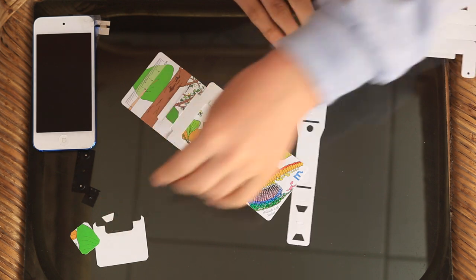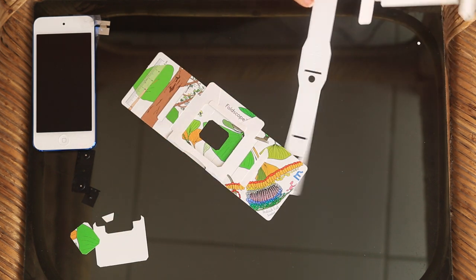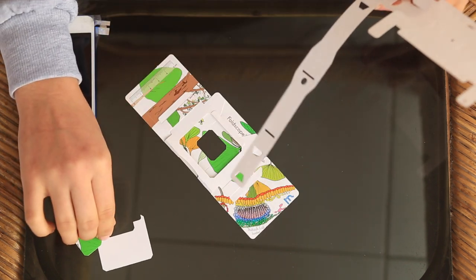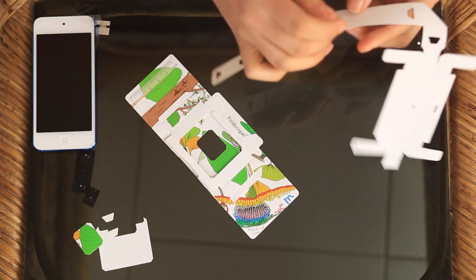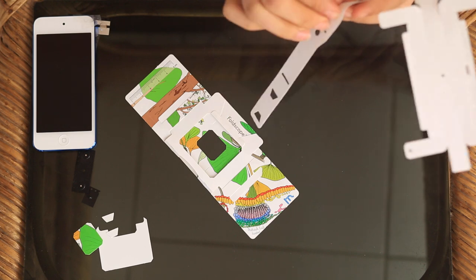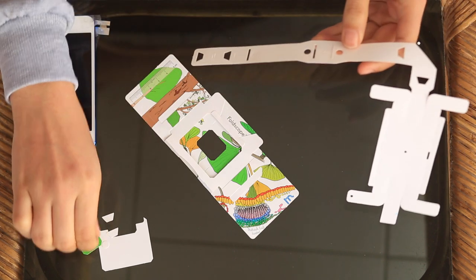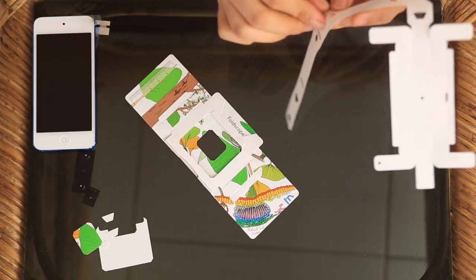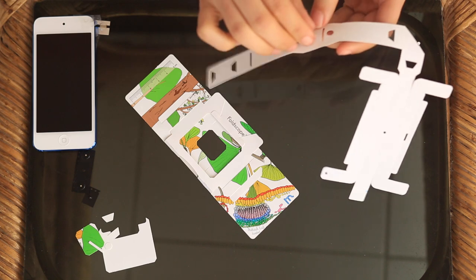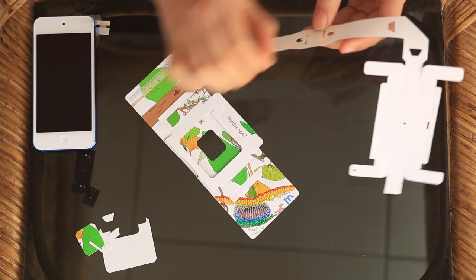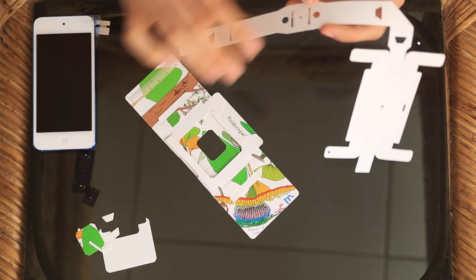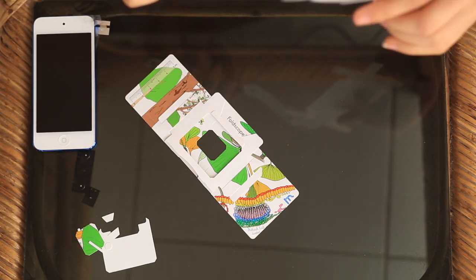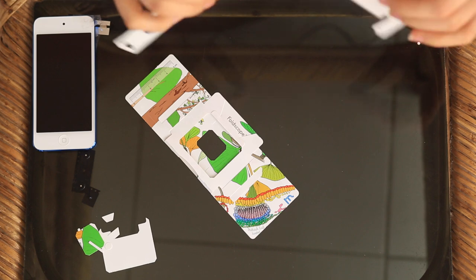Then you go to the turtle. You have to take out all these other little parts that are left behind. Especially to make sure that these holes are clear because that's where your light is going to come through.